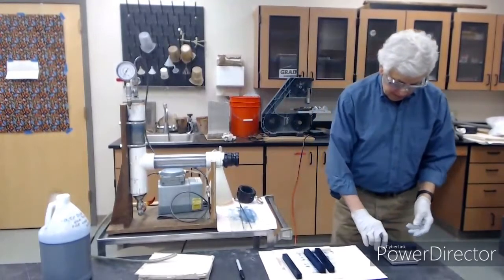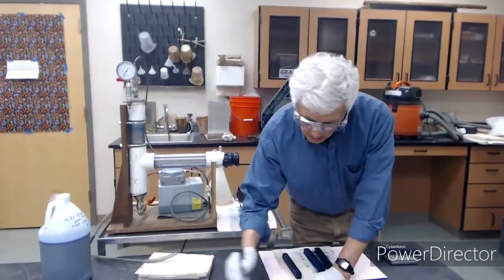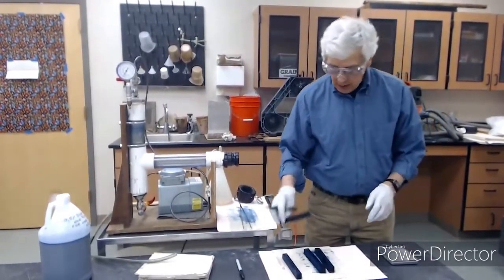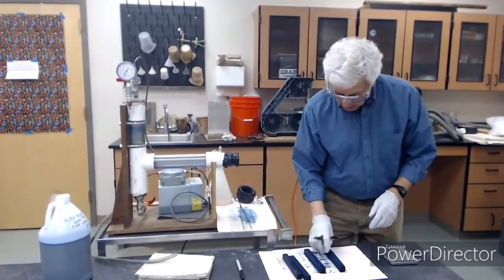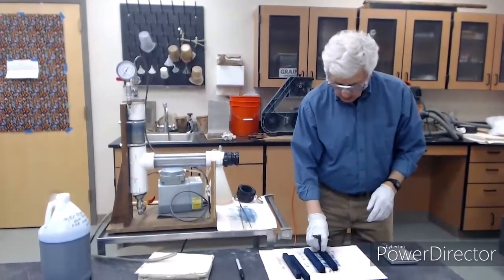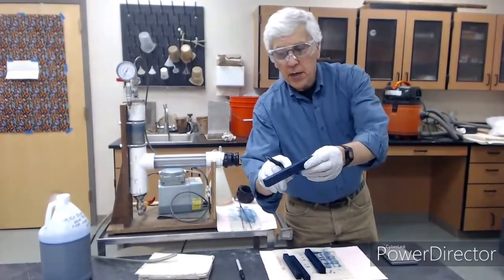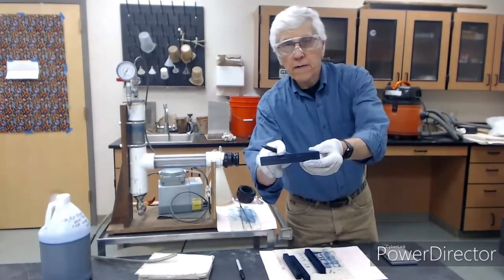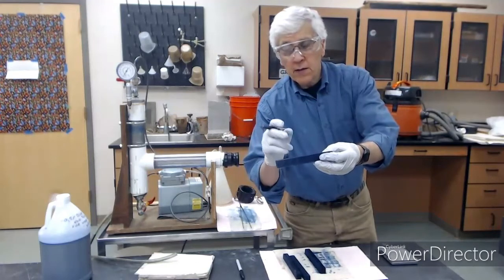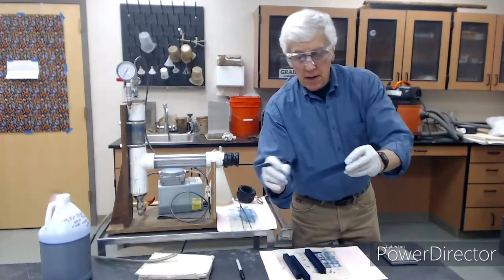Douglas fir 1. 31.27. And it started out at 22 approximately grams. And both of our southern yellow pine are still bleeding. And you might notice here, I'll try and take a picture of this with my camera, it appears to be some untreated spots here on the surface. I suspect those are pitch pockets because the pitch is very hydrophobic and it's not going to treat, water's not going to penetrate. So that could be the explanation for that.